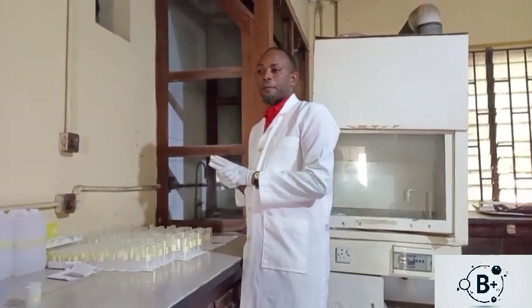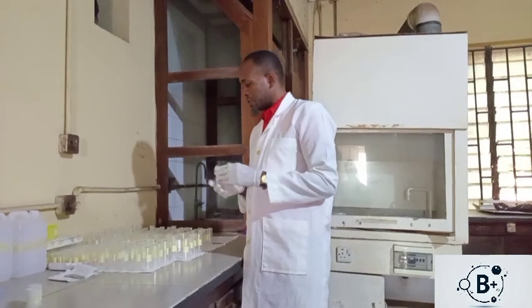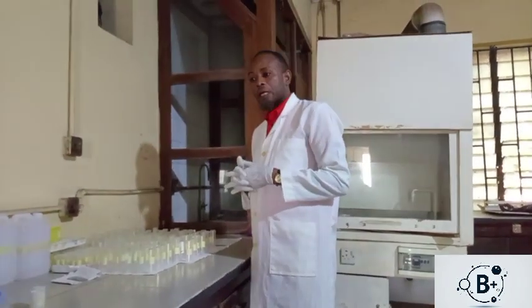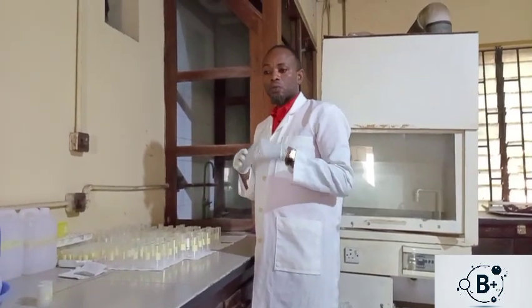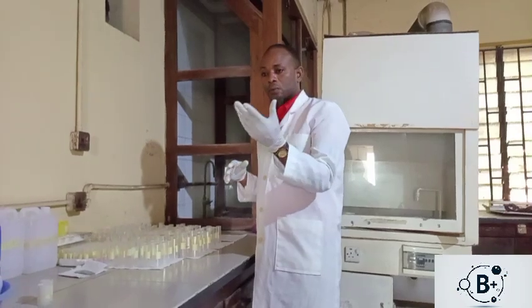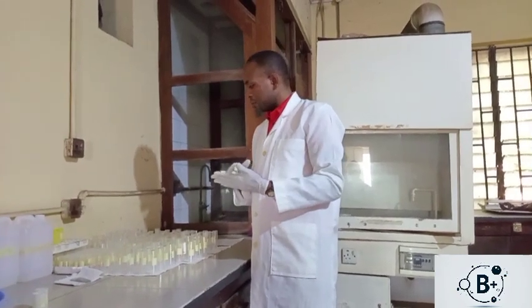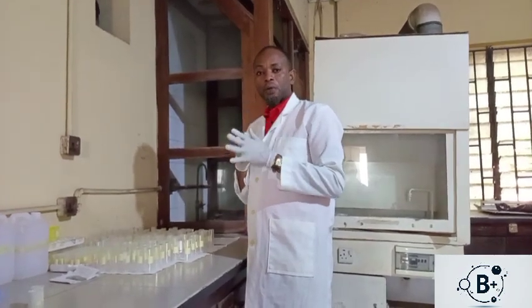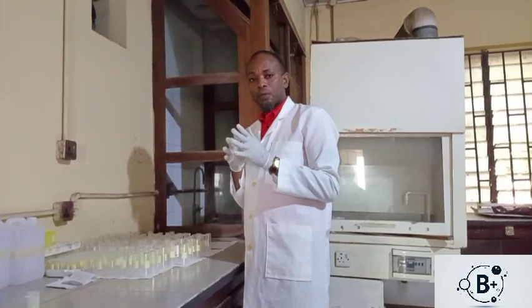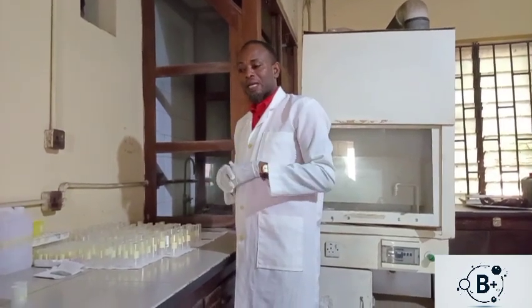Let me quickly mention that when you are culminating your experiment, at the end of the experiment, you want to get the required blood samples or get the required tissues from the animals.